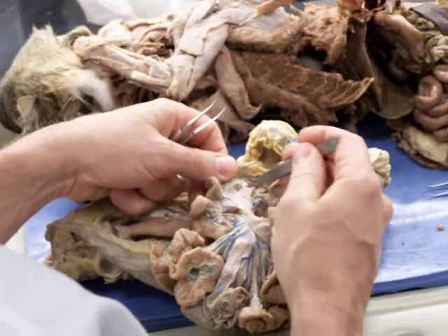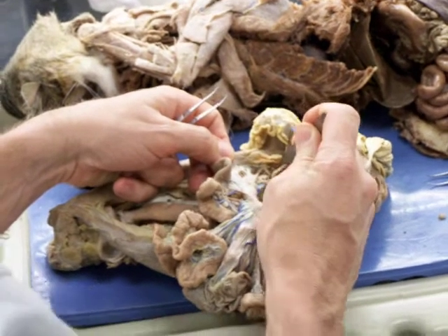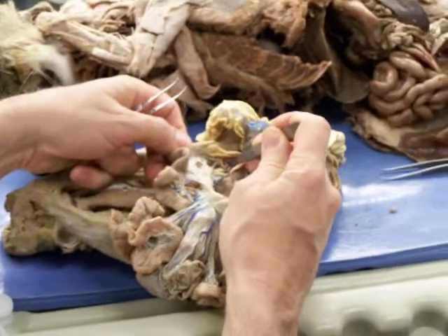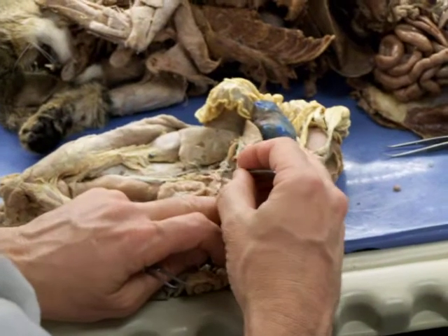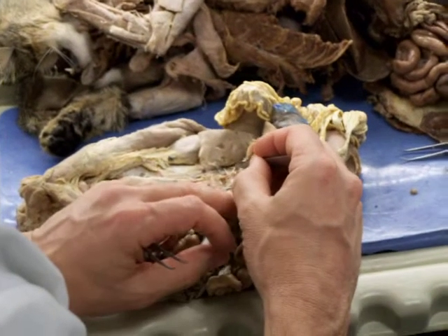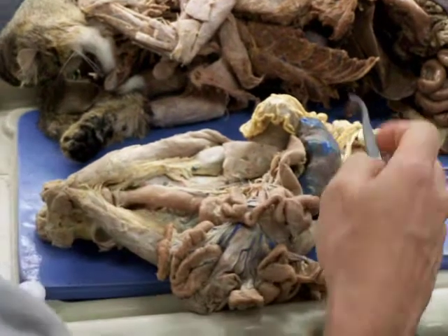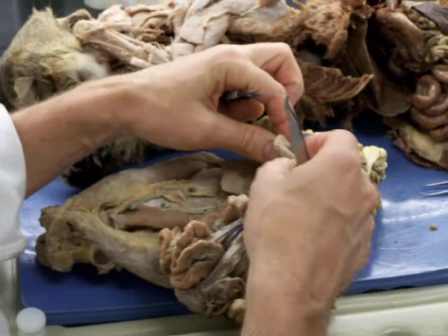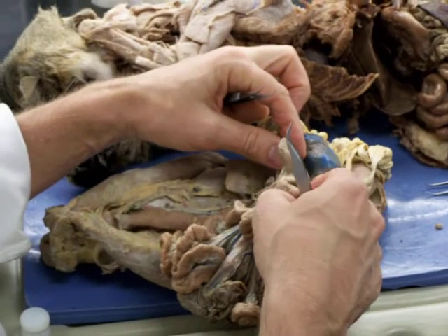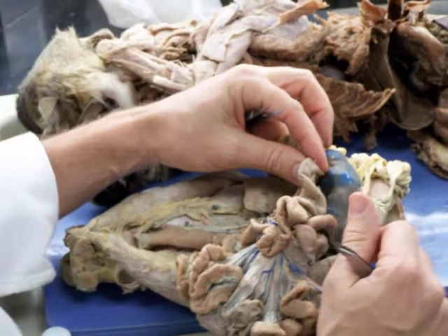Most of the pancreas has been removed down here. And it runs up in anastomosis with the cranial pancreaticoduodenal. And that's the caudal pancreaticoduodenal right here. This is caudal pancreaticoduodenal. So the caudal pancreaticoduodenal is going to serve the cranial parts of the jejunum and the caudal portions of the duodenum.